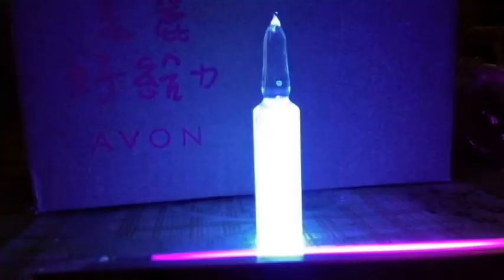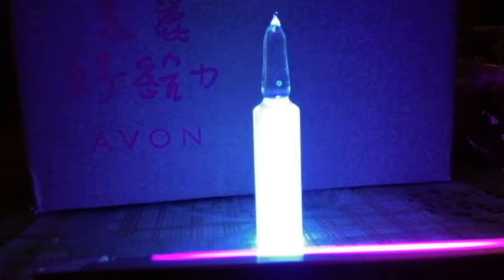Hello everyone, welcome to my lab. In this video, we're making quantum dots from sugar in a very common way.